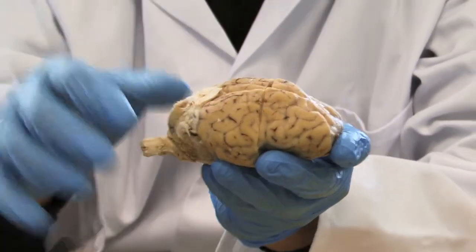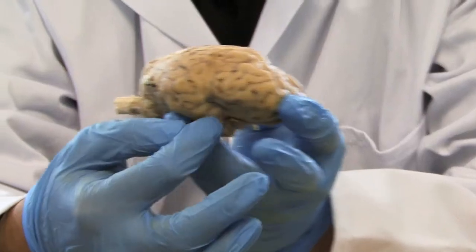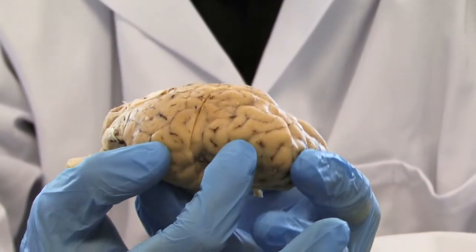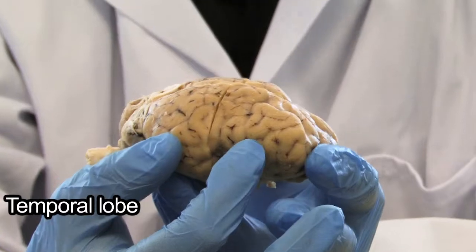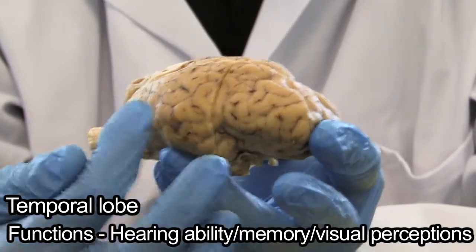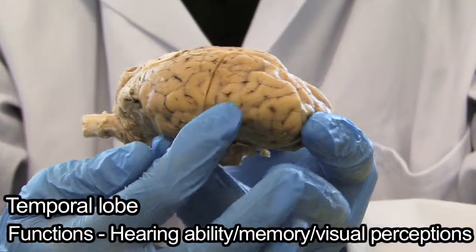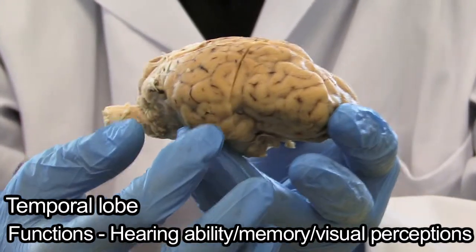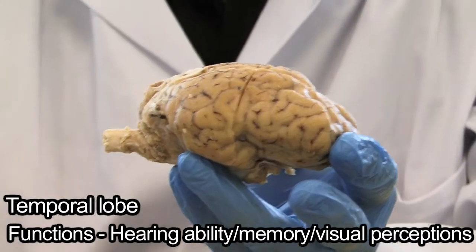Moving on from there, we then look at this bit over here on this side, referred to as the temporal lobe. The temporal lobe is important in hearing ability, memory acquisition, and also some visual perceptions as well.